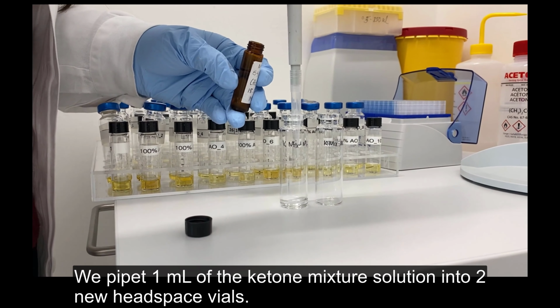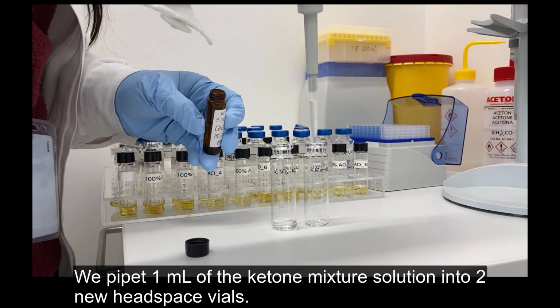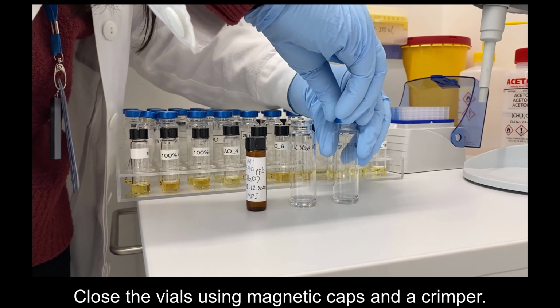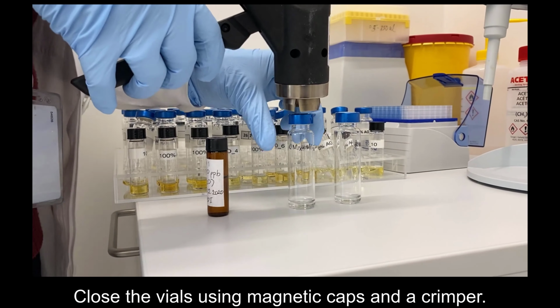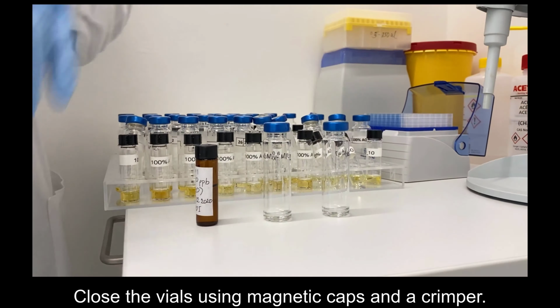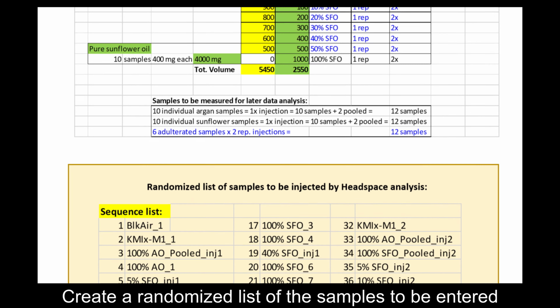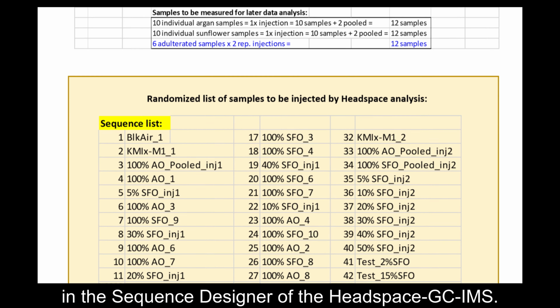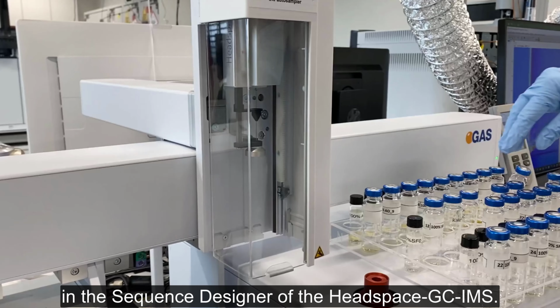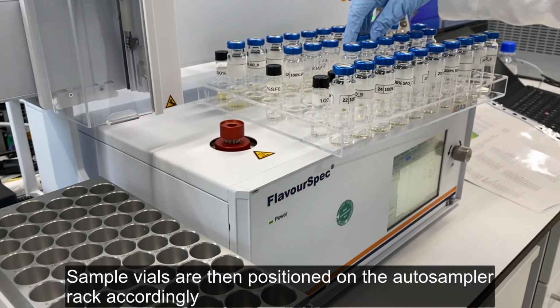We pipette 1 ml of the ketone mixture solution into 2 new headspace vials. Close the vials using magnetic caps and a crimper. Create a randomized list of the samples to be entered in the sequence designer of the headspace GC-IMS. Sample vials are then positioned on the auto-sampler rack accordingly.